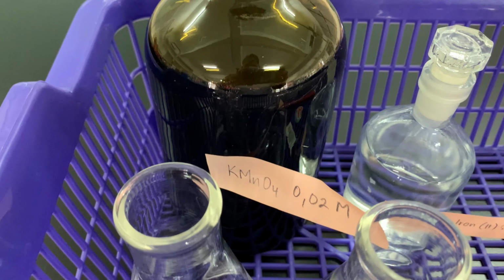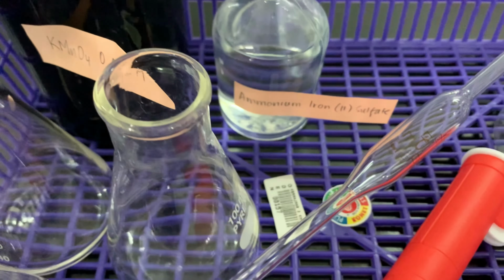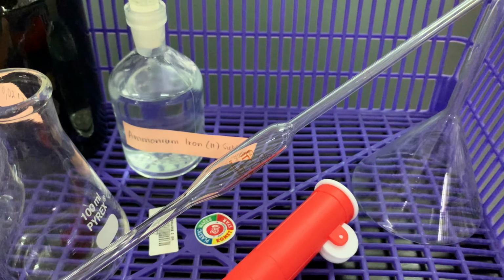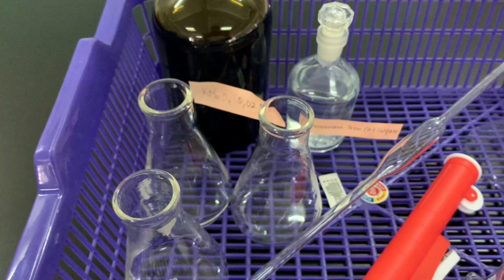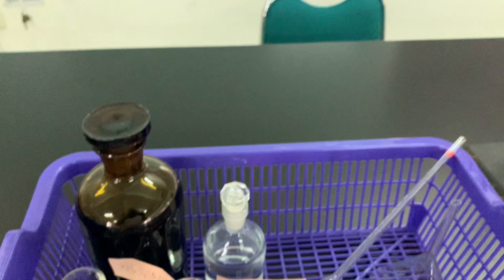In this experiment, we will determine the amount of iron 2 in the sample using redox titration. This redox titration can be used for many possible IA topics, such as comparing the amount of iron 2 in supplements or tablets, or iron's amount in samples of different leaves or vegetables.